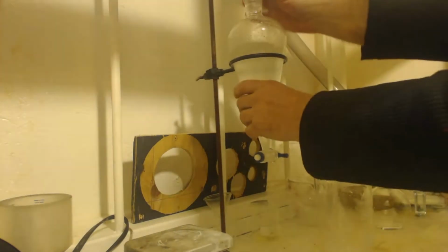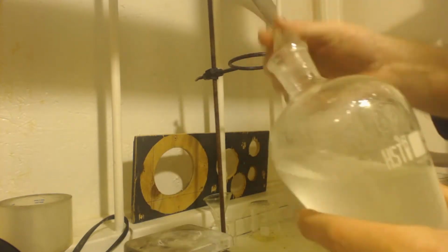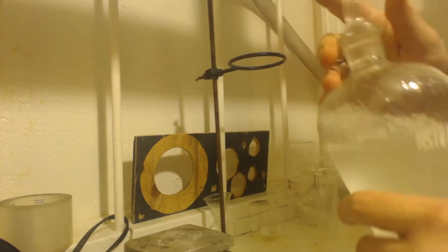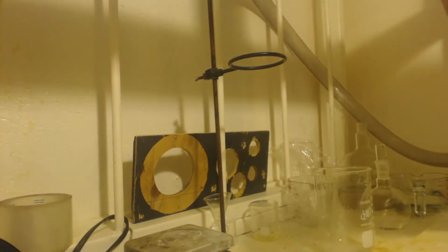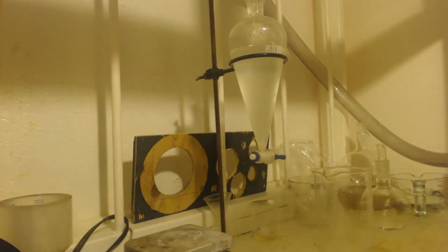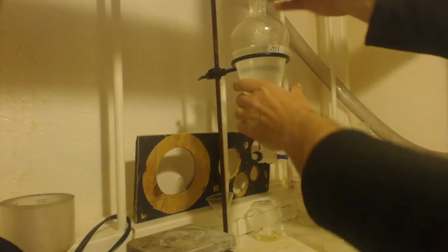Going to shake it, make sure I vent. We'll let it sit for about 20 minutes and repeat that. So again, I'm going to drain the water out.